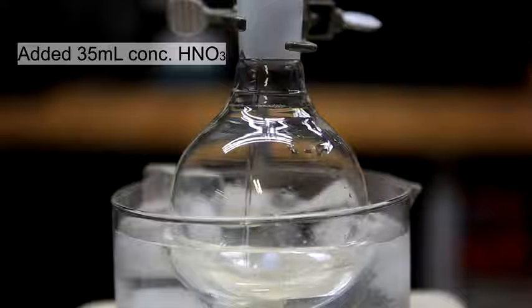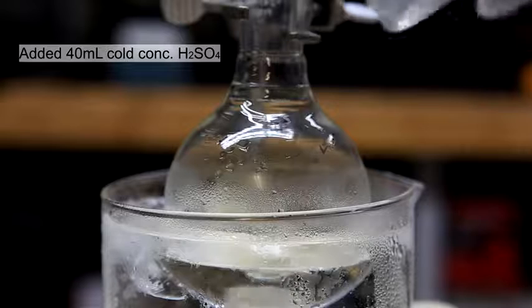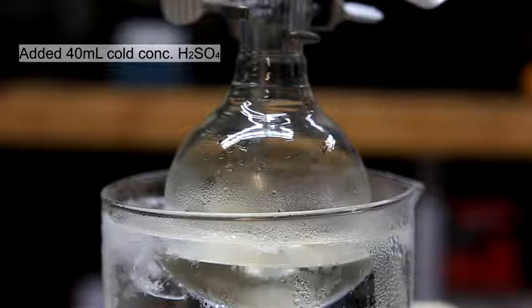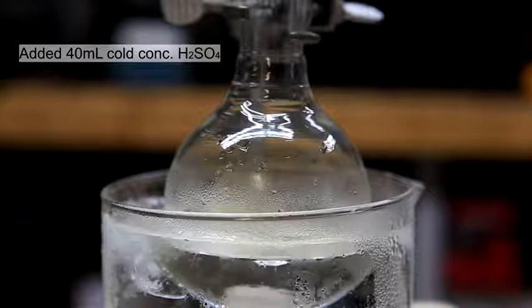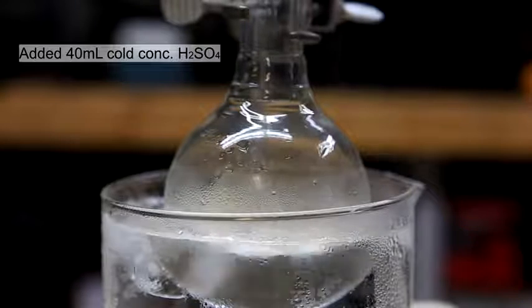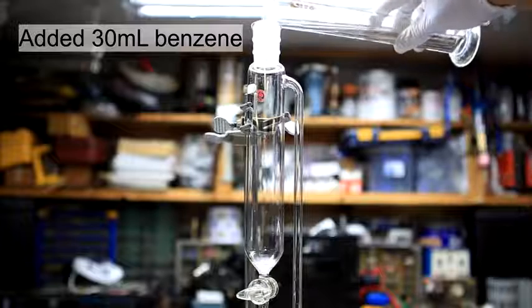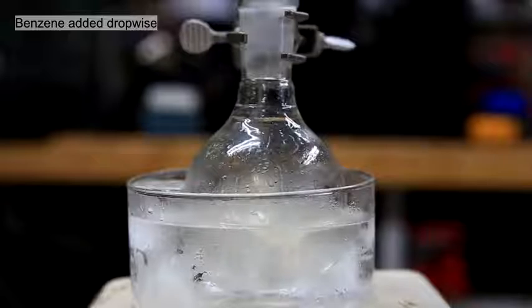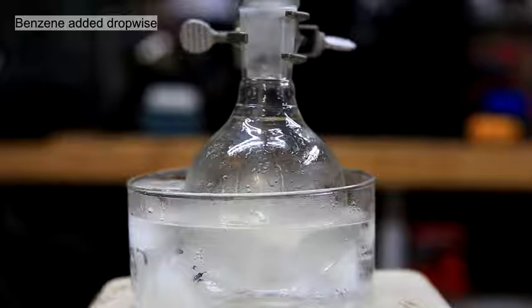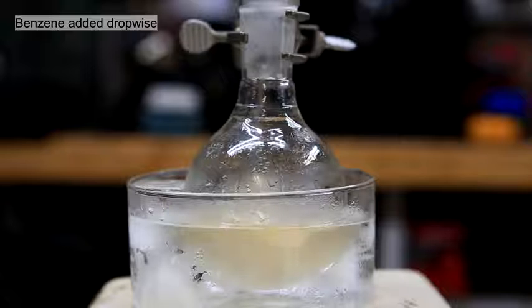35 milliliters of concentrated nitric acid was added to a round bottom flask. With stirring, 40 milliliters of cold concentrated sulfuric acid was added. The sulfuric acid was cooled by putting it in a freezer for about 30 minutes. To an addition funnel was added 30 milliliters of benzene. While the acid mixture was cooled in an ice bath, the benzene was added dropwise. It is important to keep the temperature below 55 degrees Celsius at all times.